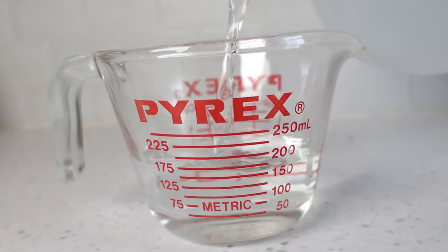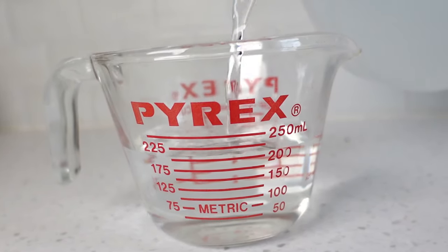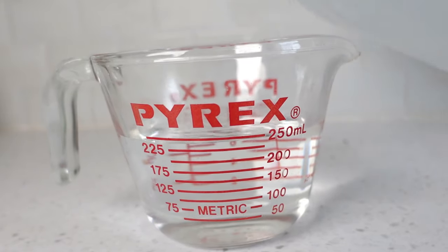Now I'm going to walk you through the calibration process step by step. We'll do one buffering packet at a time. Start with 250 milliliters of distilled water. This water needs to be 25 degrees Celsius. Depending on where you live, room temperature may be just right, but if yours is a little below, here's how you can bring it up to the correct temperature.